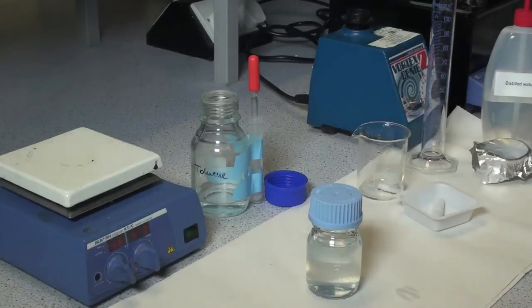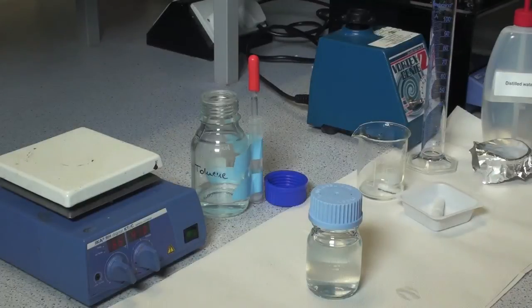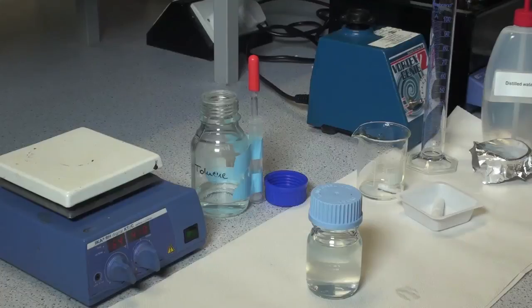In this example we dissolve the starch in distilled water, but it could just as easily be dissolved in a buffer of choice.